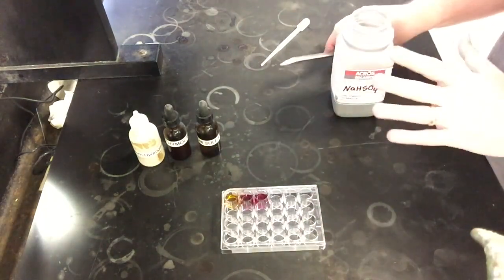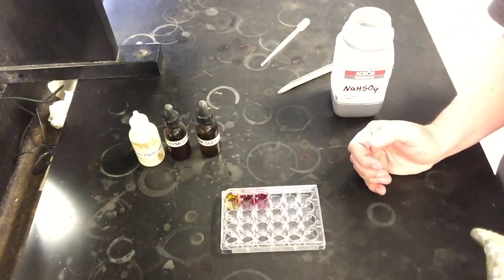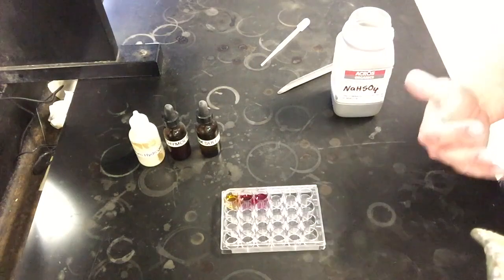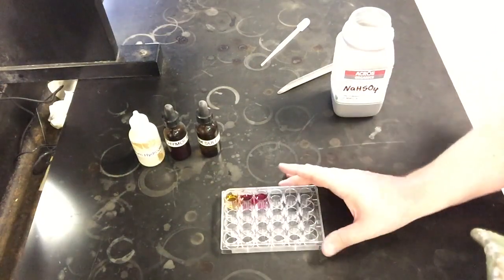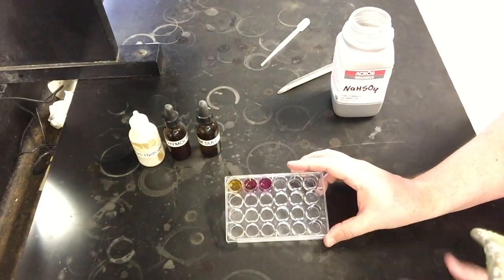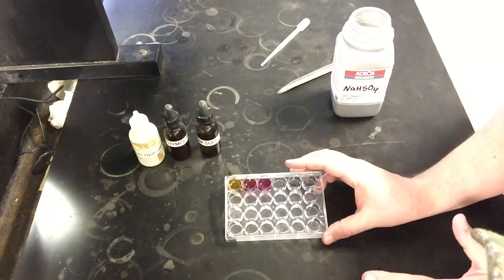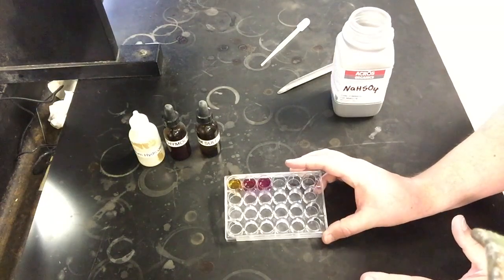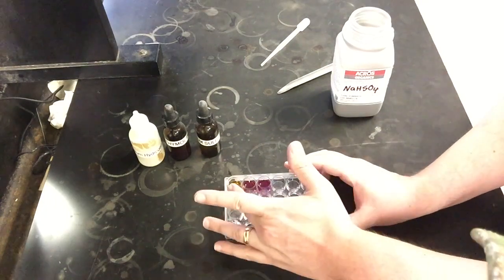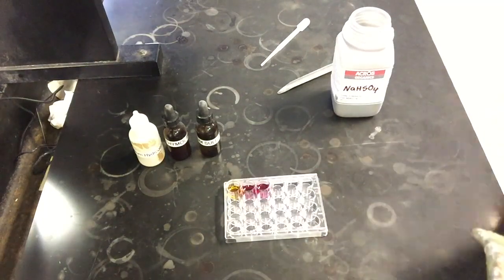I think what we're probably seeing here is the fact that it's not changing and lightening up. It's not going backwards to the reactants. But by adding our sodium hydrogen sulfate, we should expect that our color, by adding a reactant, probably should be getting a little bit more towards the product side. But if we're looking at our colors, we don't really see a huge change. If you look at CSE Pub, it's probably going to ask you, does the reaction go forward or backwards? In this case, we'd probably say it is going towards the products as the darker color, because it didn't go light like what we saw very clearly the first time. And so that would be how I would treat that particular one.